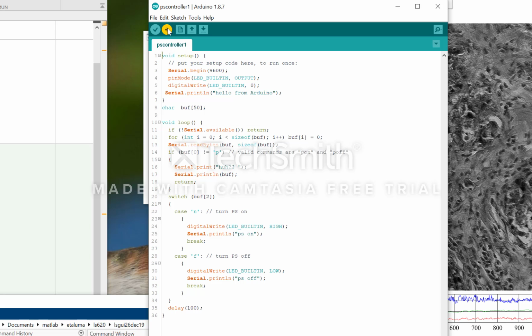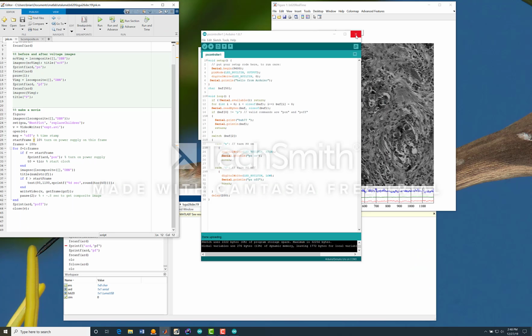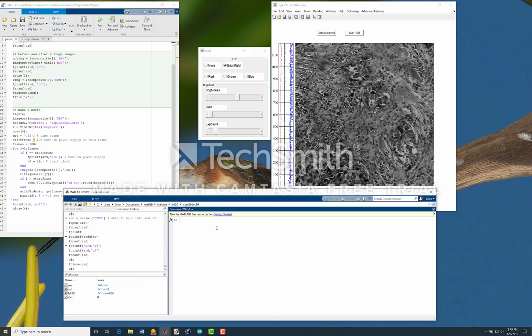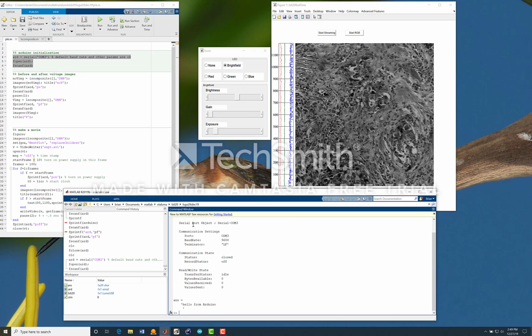We will upload this code to the Arduino, and then that code will be called from Matlab over here, where we use fprintf after initializing the Arduino. We can send the commands to the Arduino, the on and off commands. So just as we did with the lumascope, we need to quit the IDE because we can't share the serial port. And first thing we're going to do is connect to the Arduino. And we are connected. If we fprintf Arduino POFF, and then fscanf Arduino, it returns saying I turned off the power supply.